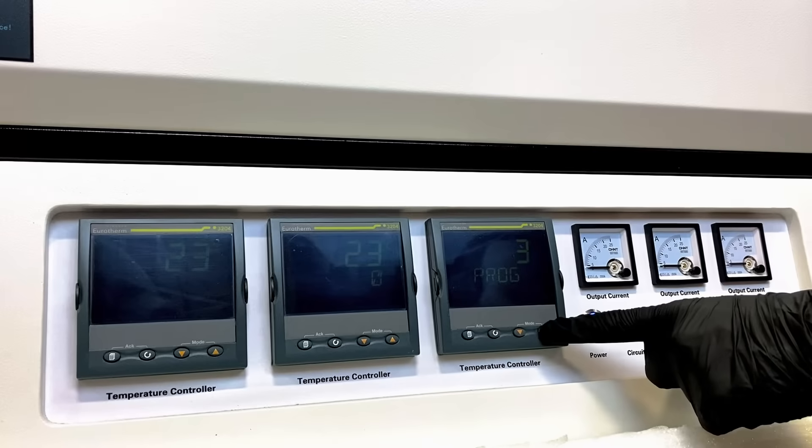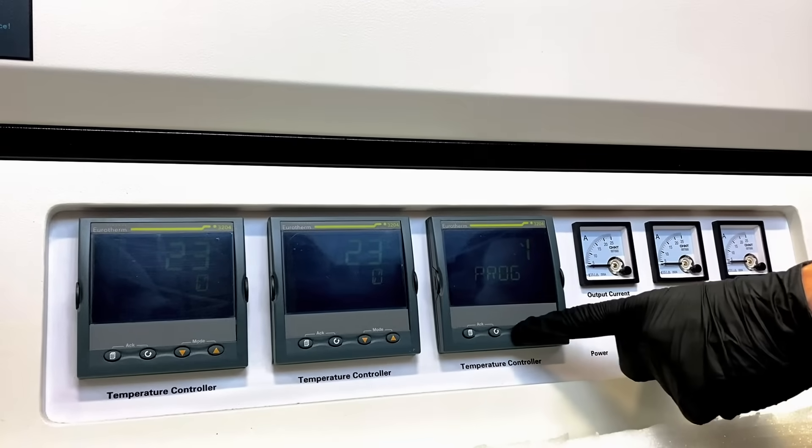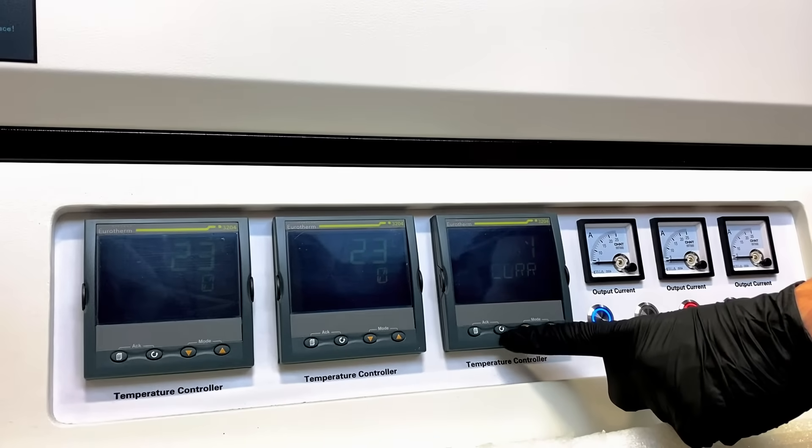This is where we select which program we are going to edit. Let's edit the first program and press the cycle button again.